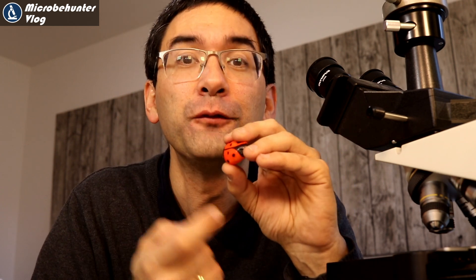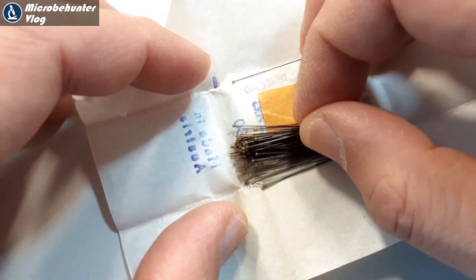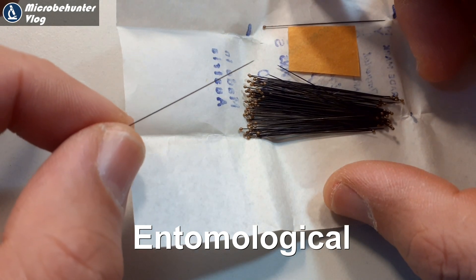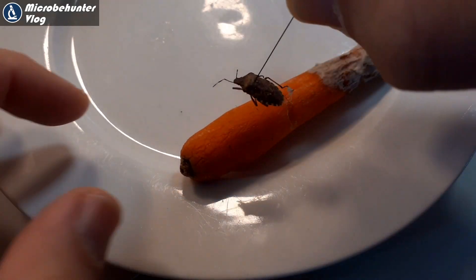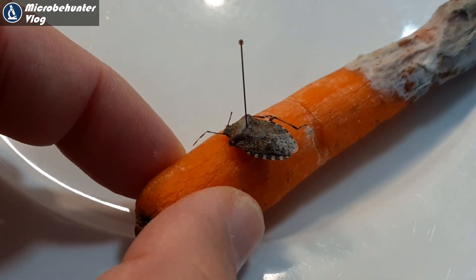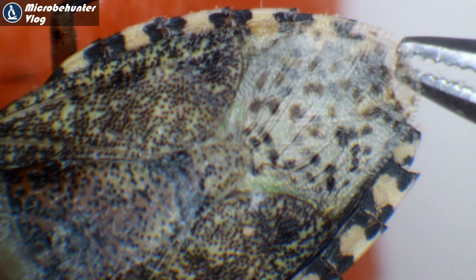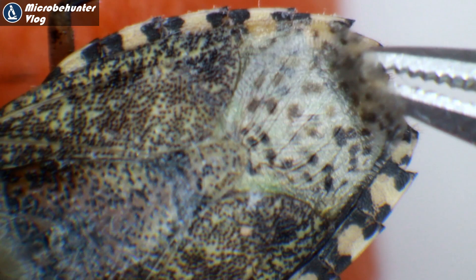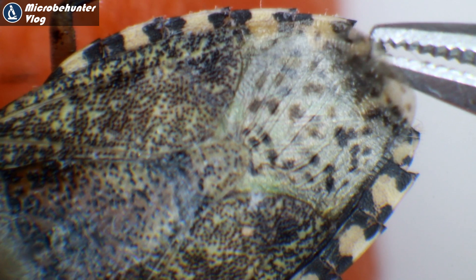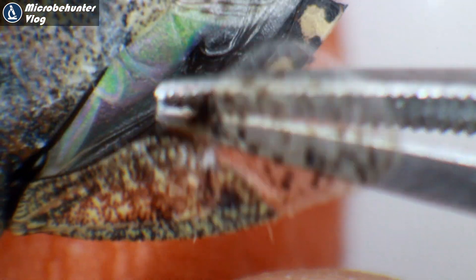It was a little bit difficult to get a closer look at the bug, so I used entomological needles — very sharp and very thin — to pin through the insect and mount it on my carrot, which you'll know from a previous video. This makes it much easier to manipulate the bug. Here we see again the back part of the wing, which is very membranous, thin, and transparent — a very typical sign that we're talking about Heteroptera: insects whose front wing is hard at the front and soft at the back.